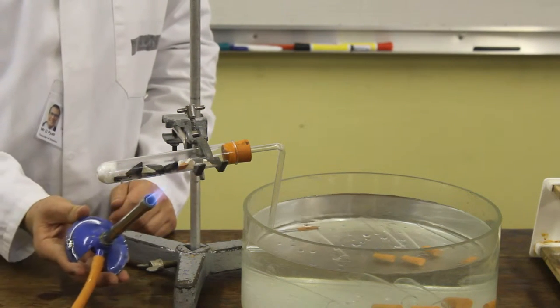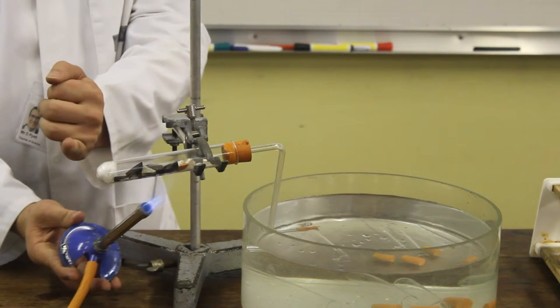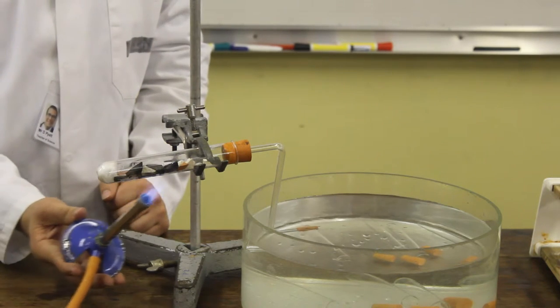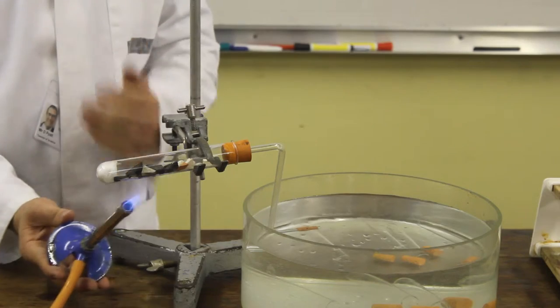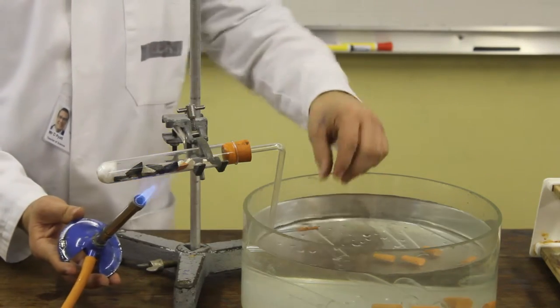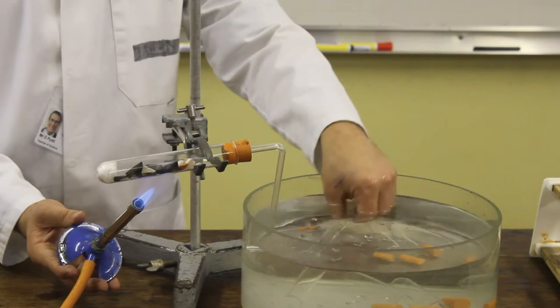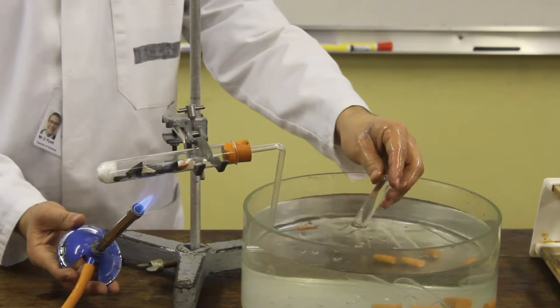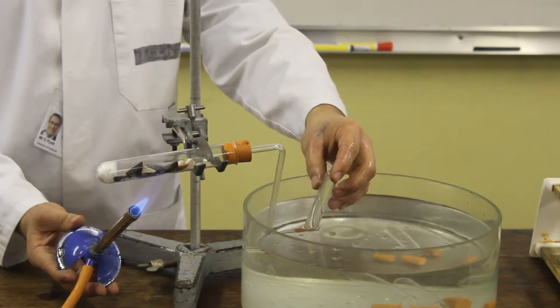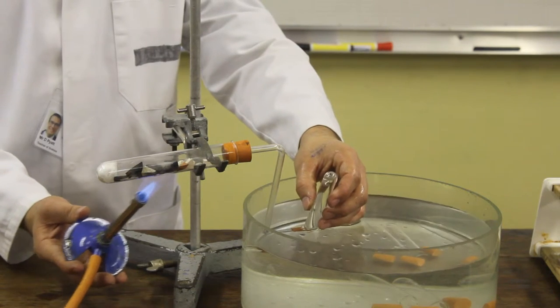Now when I start heating this reaction, I will only heat the mineral wool for about one second out of every ten that I heat the catalyst. We want the reaction to happen on the catalyst itself. The delivery tube has started to give out some gas which we'll collect in the test tubes.